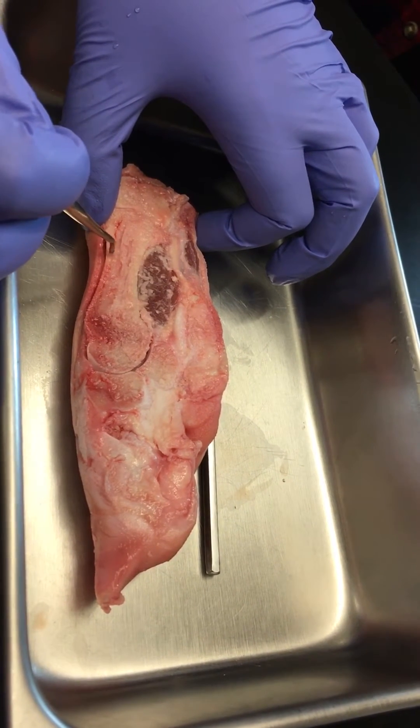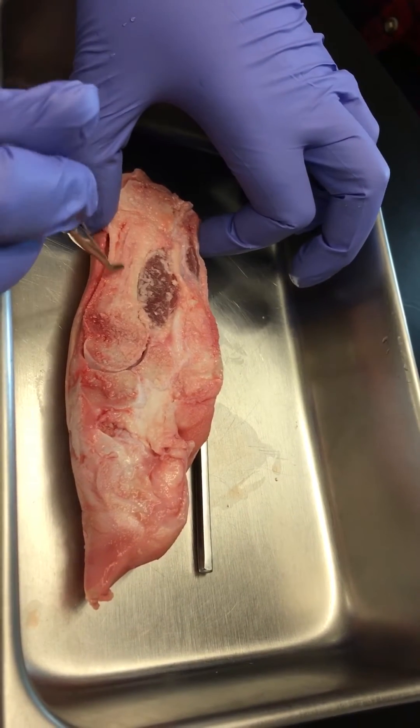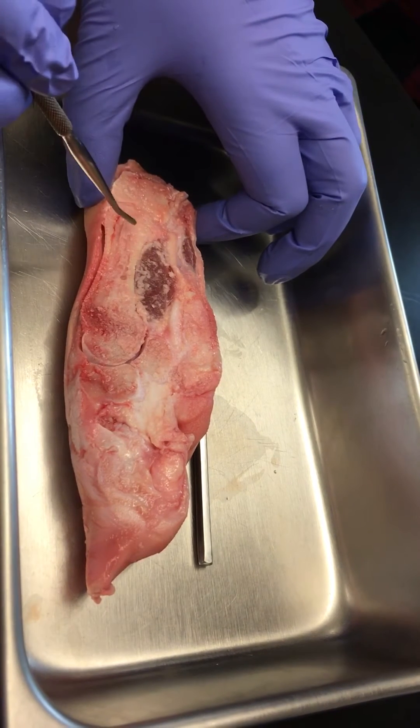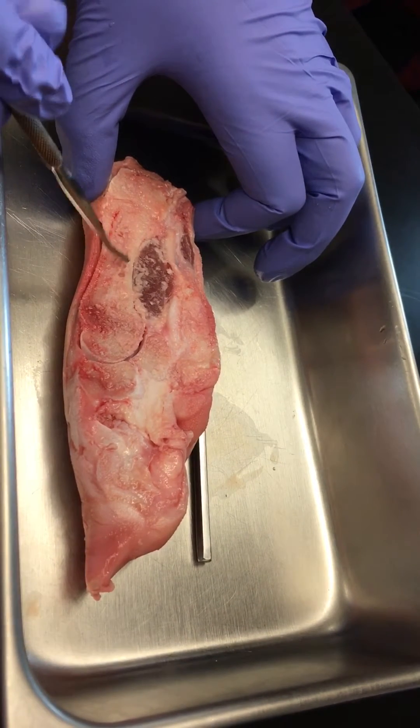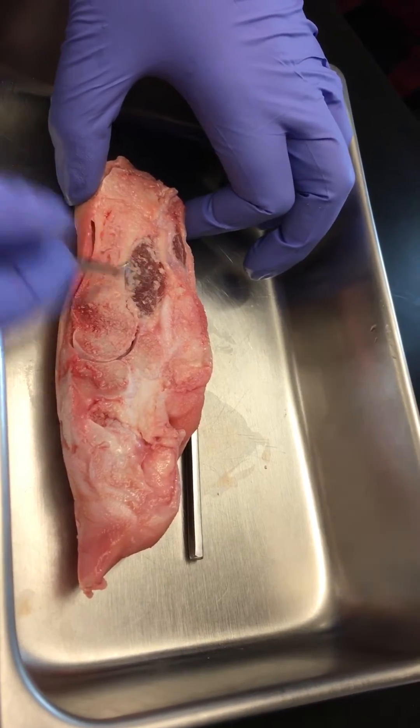You can see that hard compact bone right there. In between the compact bone in the diaphysis, you have the medullary cavity, which is a space filled with yellow bone marrow. That's what all the soft stuff is — the yellow bone marrow in that medullary cavity.